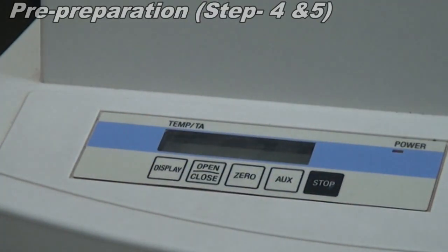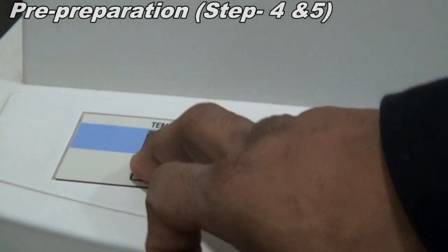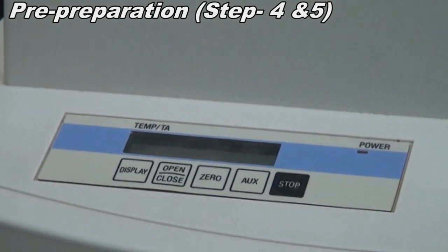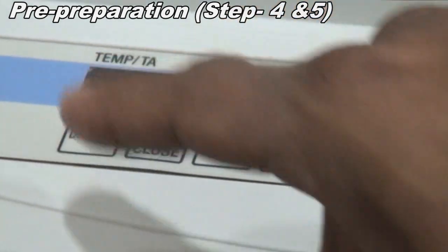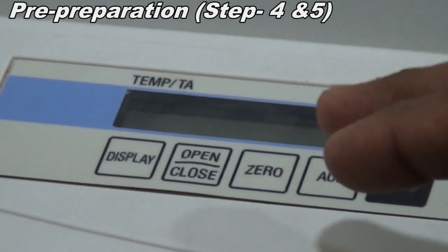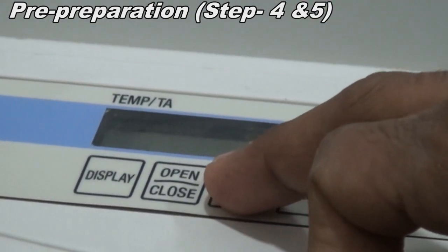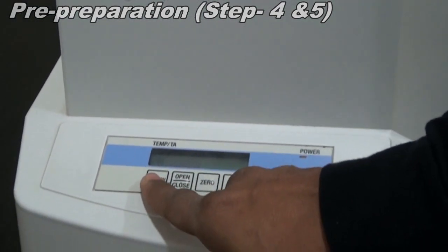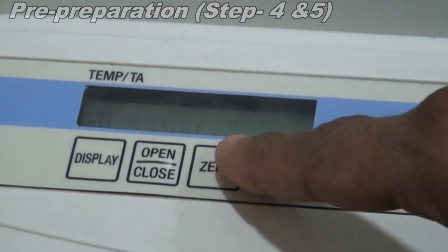Before performing the experiment, we need to check whether the temperature of the TG is ambient temperature or not. If it is not, then you have to wait. If it is ambient temperature, then you click display once. It will show the TG temperature, which is the temperature inside. You need to make this 0. Then press it once more and it will show the DTA signal. This also you have to make 0.